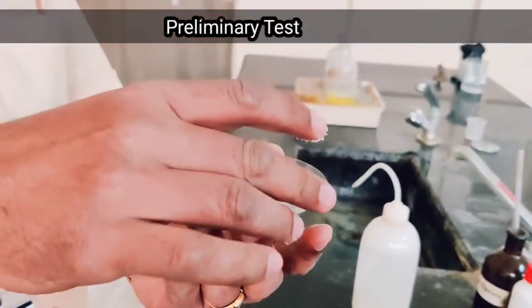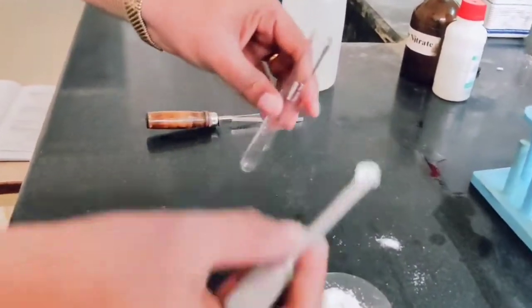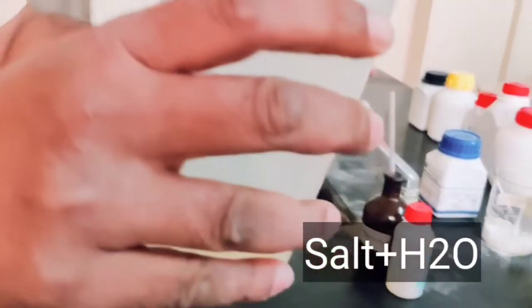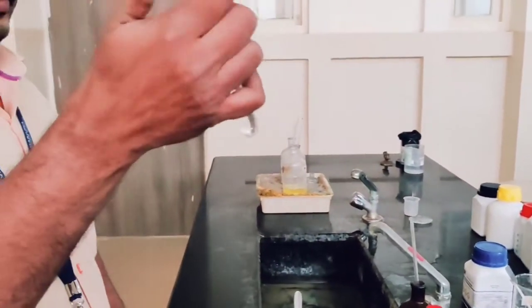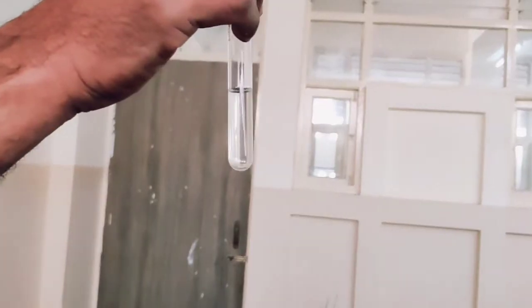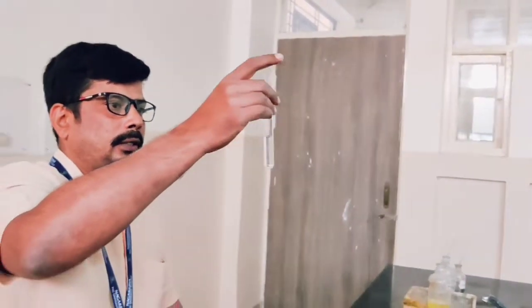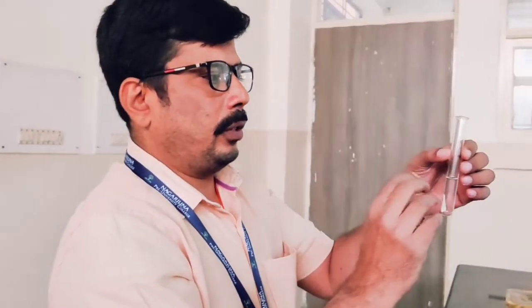Next is the solubility test. Take a pinch of salt in a test tube, add water, and shake well. You get a clear solution. If you get a clear solution, it is soluble; otherwise it is not soluble. So write: the given salt is soluble in water under cold conditions. This completes the preliminary test.